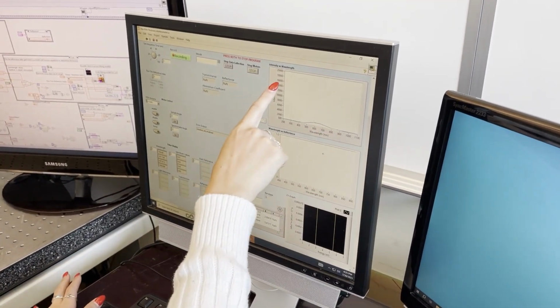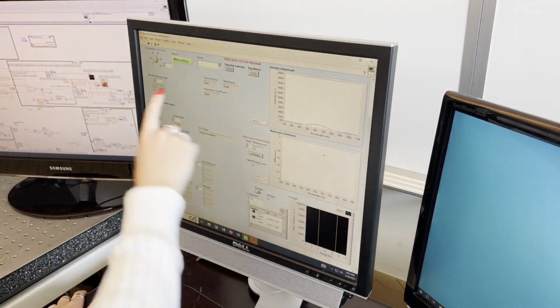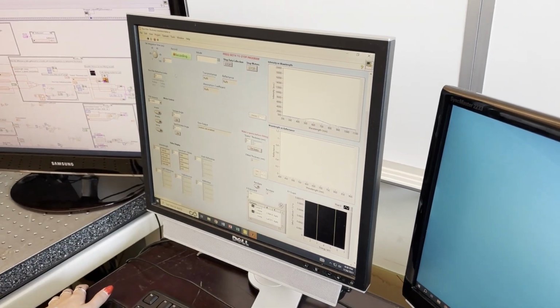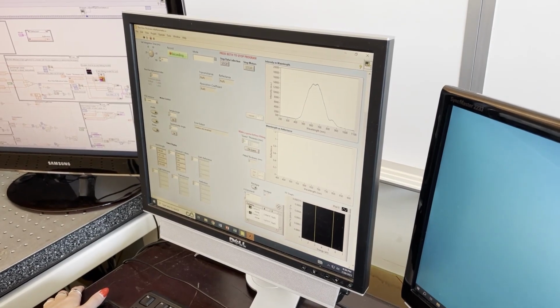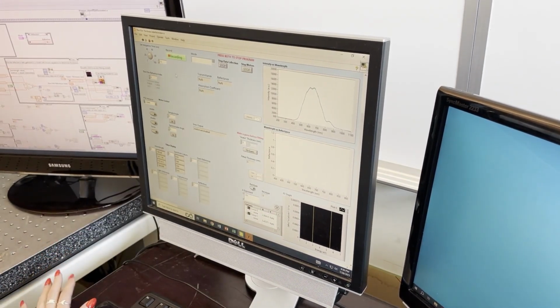Now it's probably going to clip around 16,000. So what you can do is adjust the integration time over here with the knob or with the arrows. So I'm just going to go ahead and click until I get a good Gaussian shape. See, if I go too much, it clips on the top. Just go down until you have a good Gaussian shape.